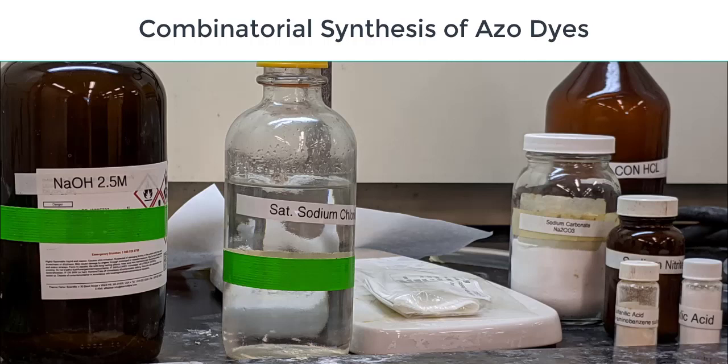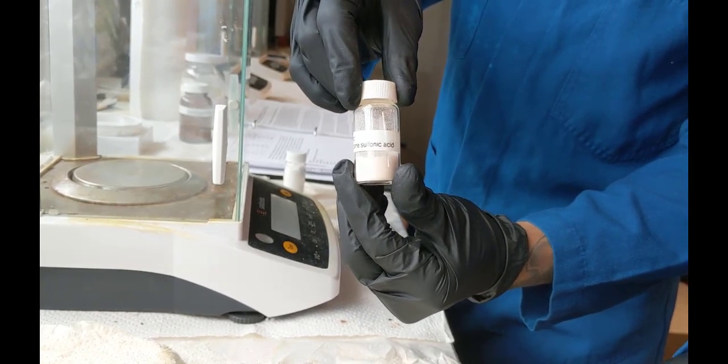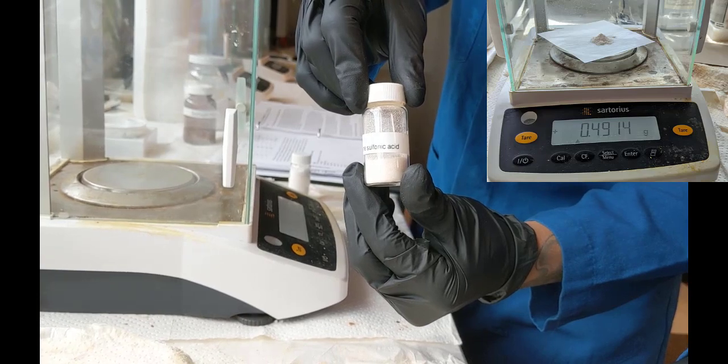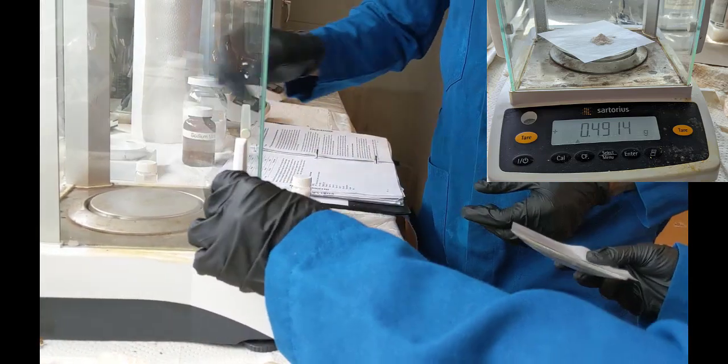Hello everyone, welcome to combinatorial synthesis of azo dyes. Today we're going to be focusing on part A of the experiment because we will be synthesizing compound C3.